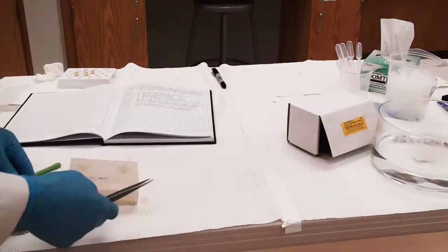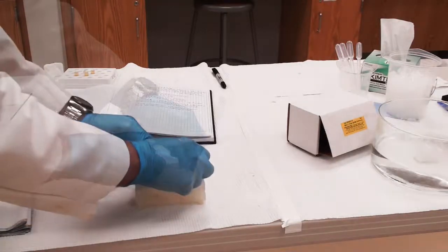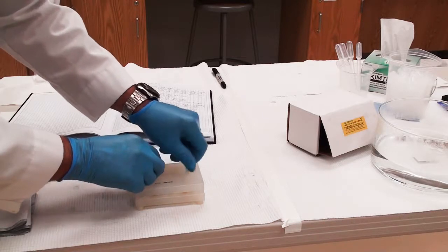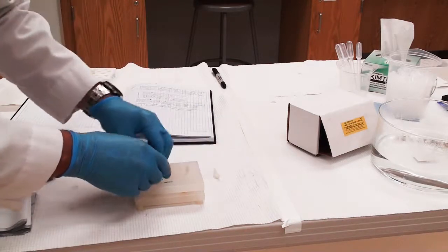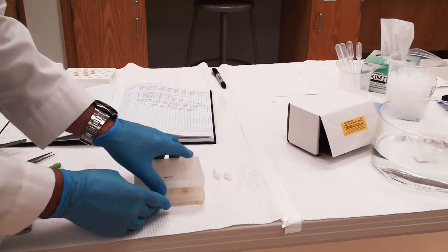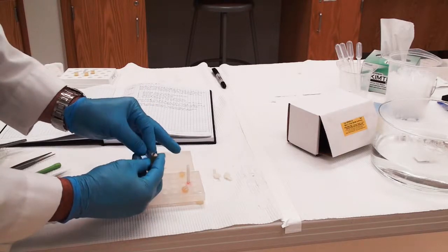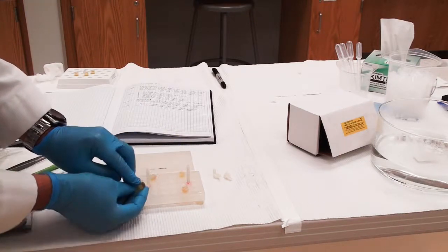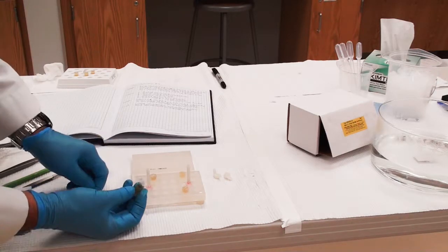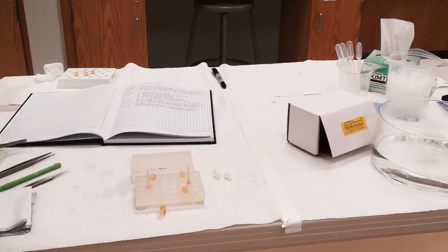And then let's take a look at the polymerization of our blocks. We process the tissues for 3 hours with a little bit of extra infiltration. I never cheat on that. And 3 hours for our polymerization, we're looking at a total of 6 hours from raw tissue to fully polymerized blocks and ready for microtomy. The resin is nice and hard. You can't get your fingernail into it just a little bit. It looks like a very good polymerization.